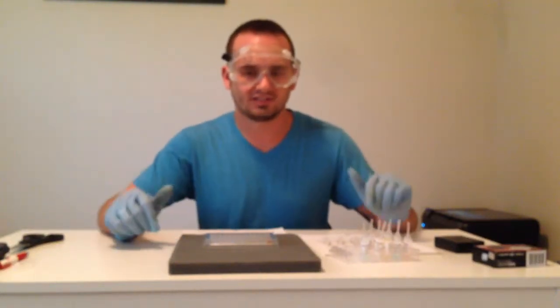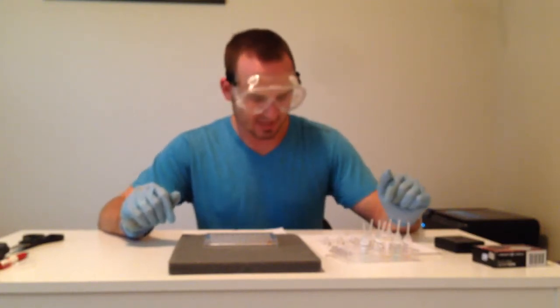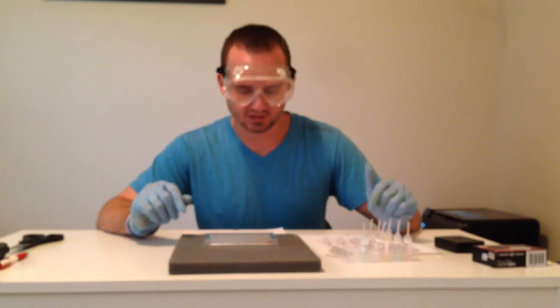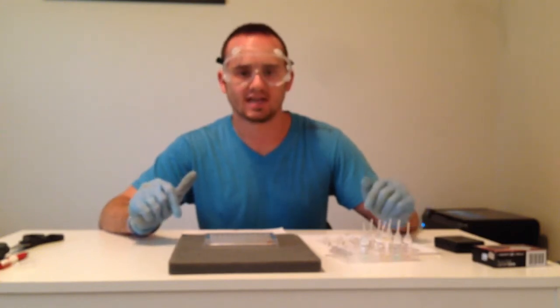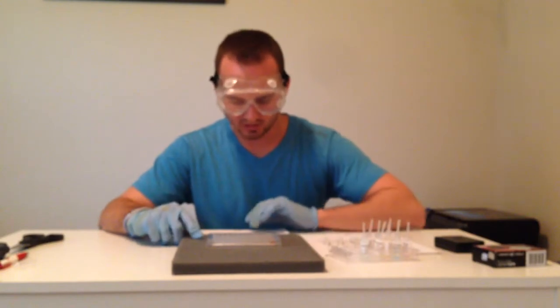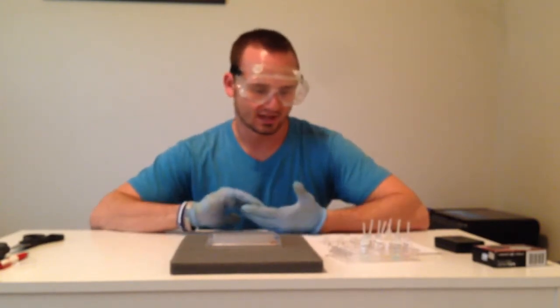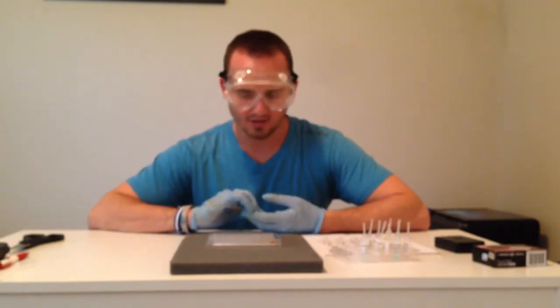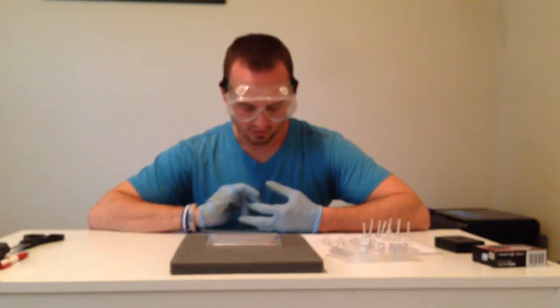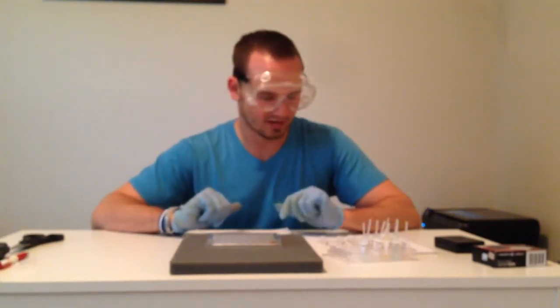Today we're doing general chemistry, lab number 6. This is ionic reactions. What we're going to be testing for is different ion concentrations, cations, anions, and we're going to be looking for precipitate formed from things like bicarbonate, chloride, iodide of various substances. So always gloves on, eye protection, don't want any of this stuff near us.